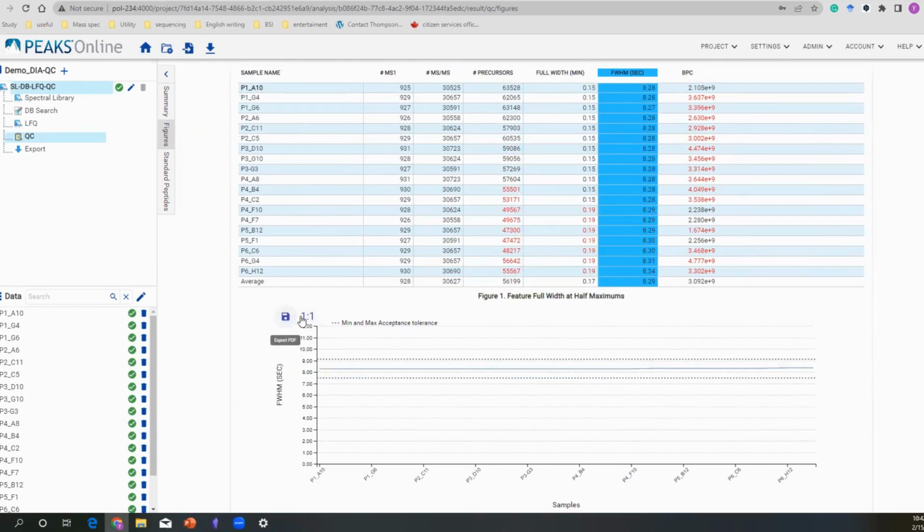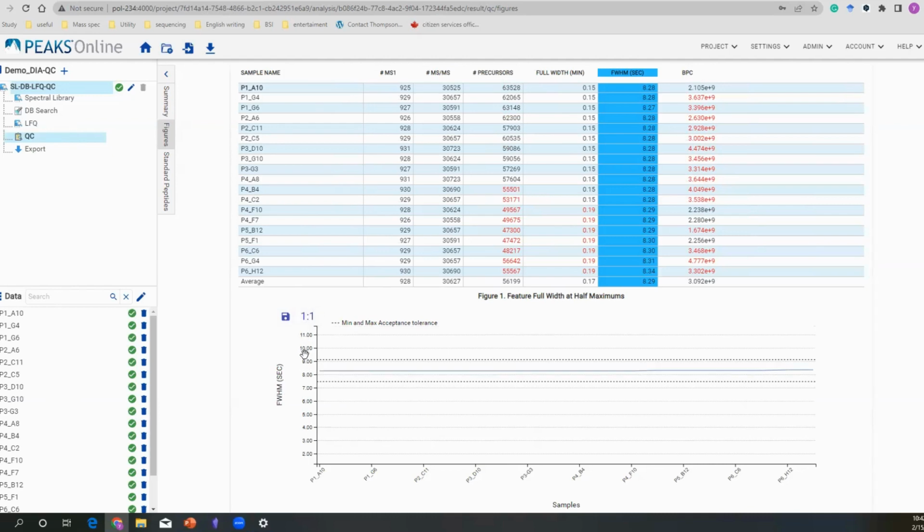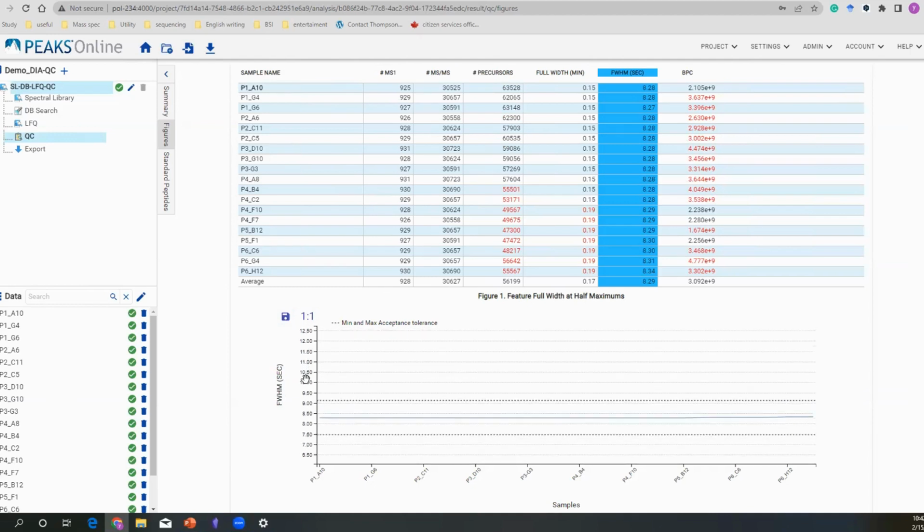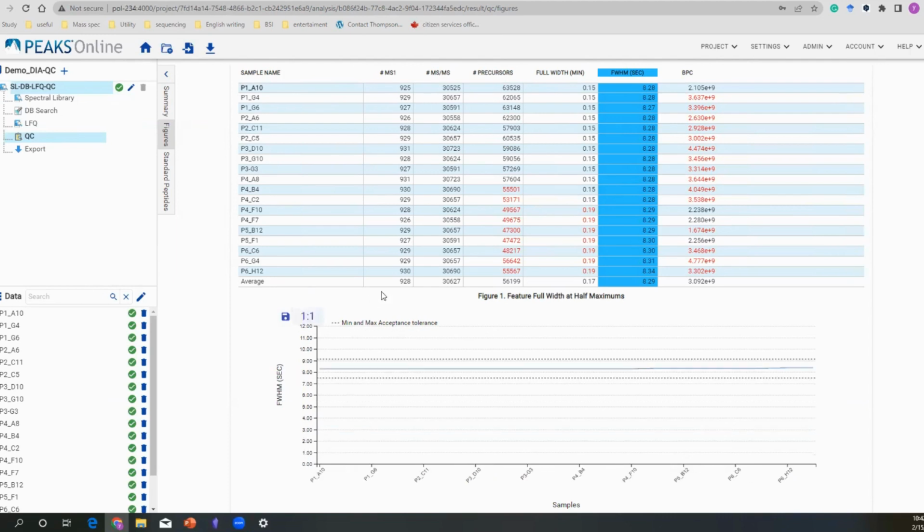You can also export this figure into a PDF format, so easy for you. Maybe you need to populate this data, so that's easy for you to generate any figure. You can also zoom in and zoom out on this one. As simple as, I'm using Windows, I'm still using scroll to zoom in, and also to zoom out on the X and Y axis. Once you think, okay, I've had enough, you can click 1-to-1 and bring everything back to the initial state.